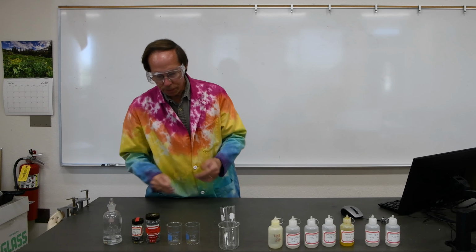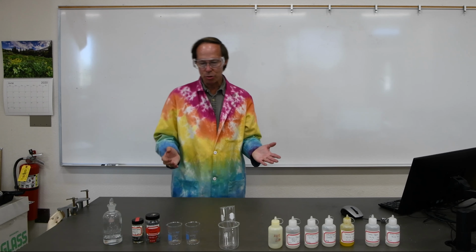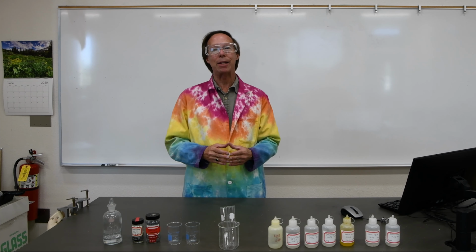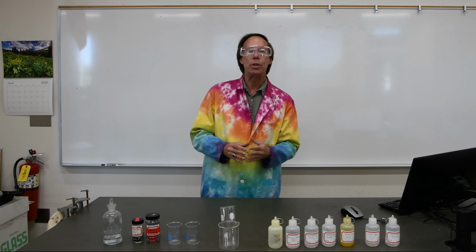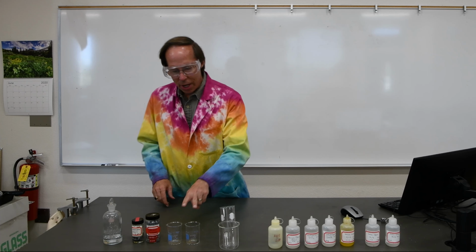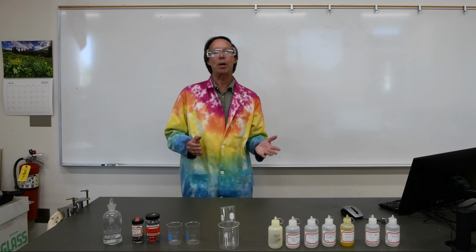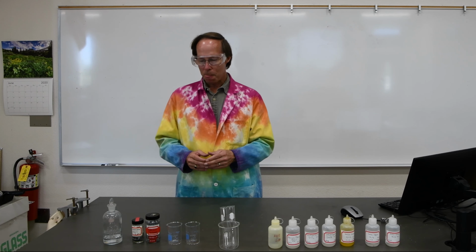You'll want to observe what happens in the reaction because one of your tasks is to determine which of the two metals is the more reactive, so we can get an idea whether the reactivity is increasing or decreasing as we go down the group. We want to save those two solutions because we're going to use the magnesium and calcium chloride that we prepared in part B of the lab.